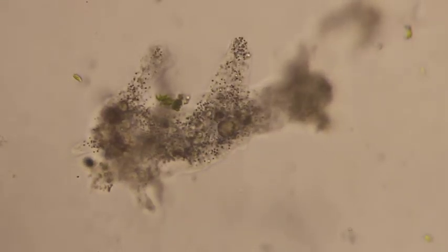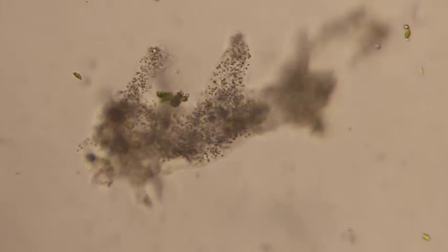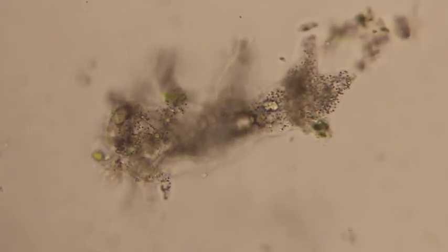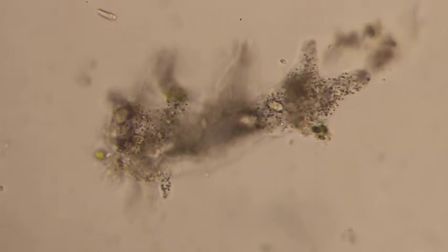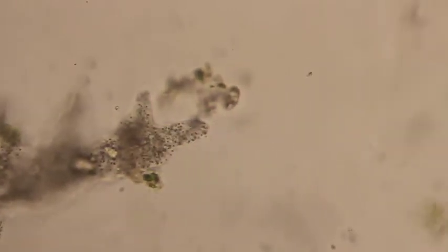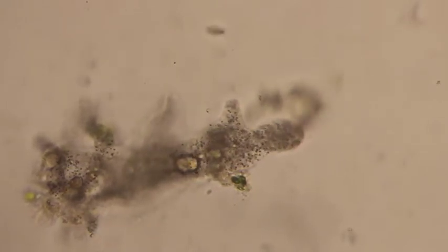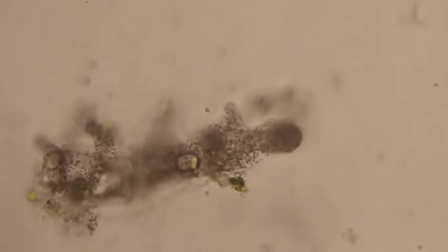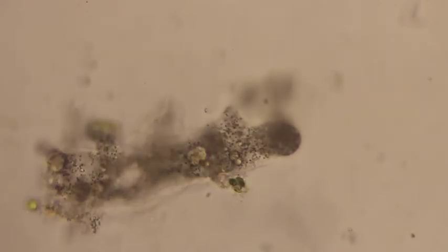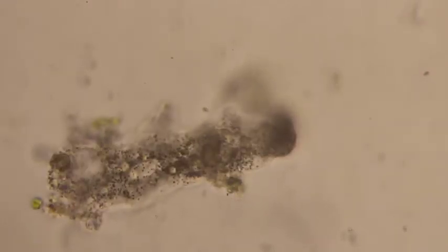Inside this amoeba cell, you can see all kinds of vacuoles where it has organisms that it's captured and it's going to eat. Some of the interesting questions I always have about an amoeba is what makes it go the direction that it goes. We can see that this amoeba is just moving along, moving forward from left to right. And I really don't know what clues or chemical signals it takes to actually figure out where to move. But they definitely have certain personalities and will move in various directions.